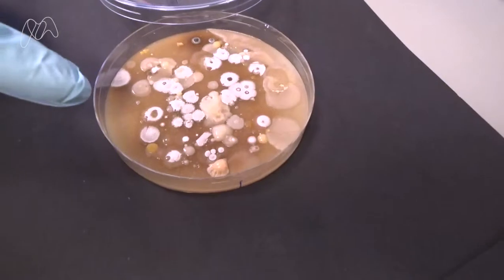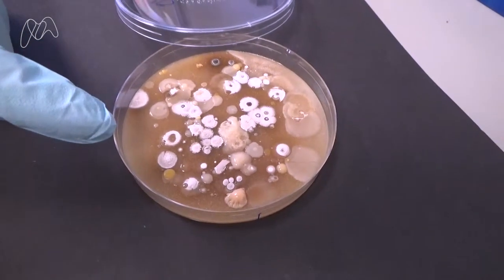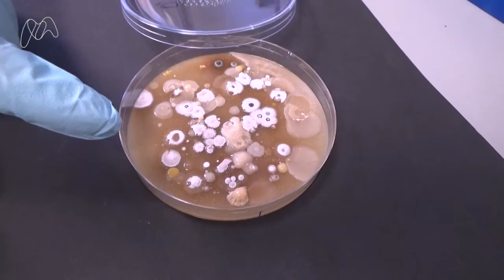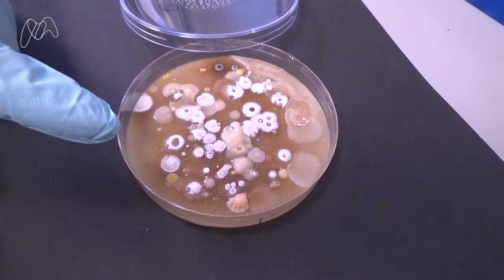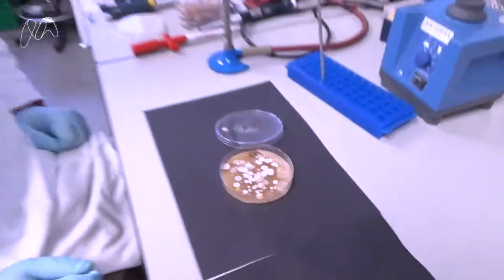These are the colonies that we think are Streptomyces but there are a lot of other things going on. In order to be sure that they're Streptomyces we need to isolate them from that plate. In order to do that we have to do some streaking.